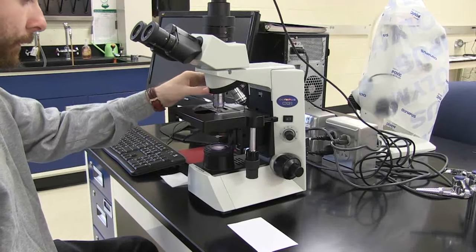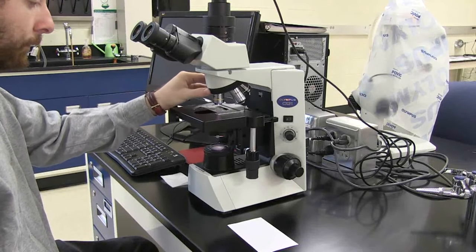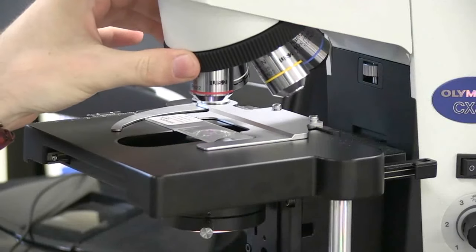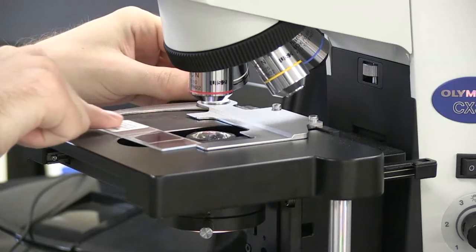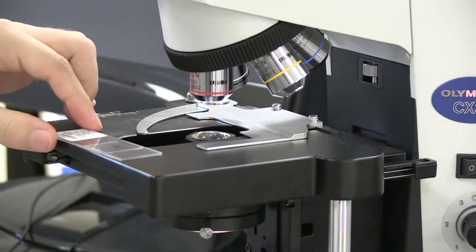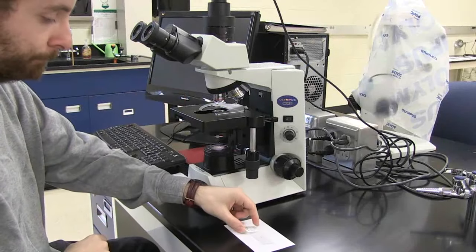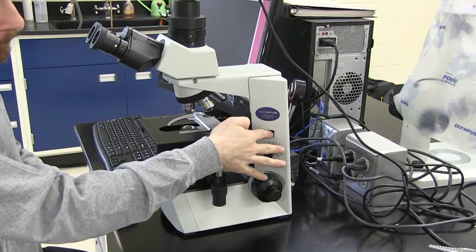When you have finished using the microscope, turn to the 4x objective, remove the slide from the stage, and turn off the microscope.